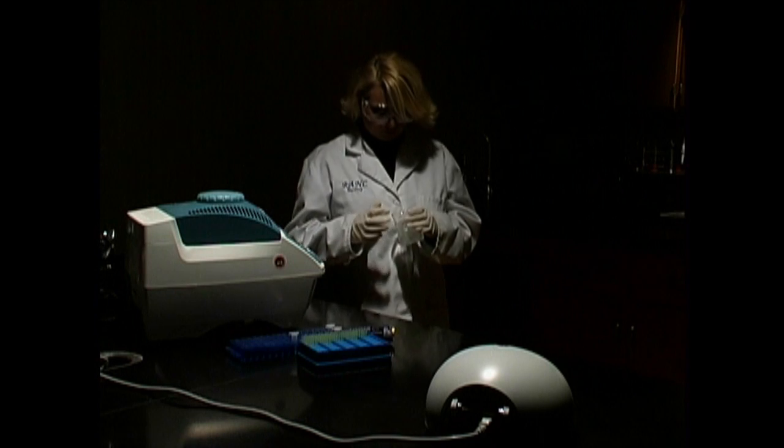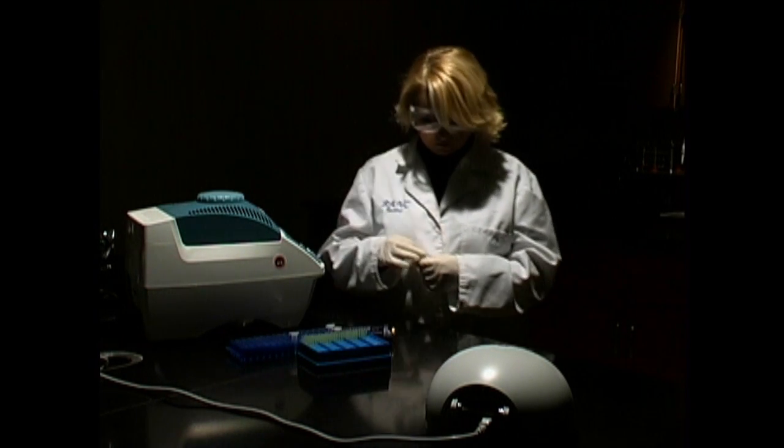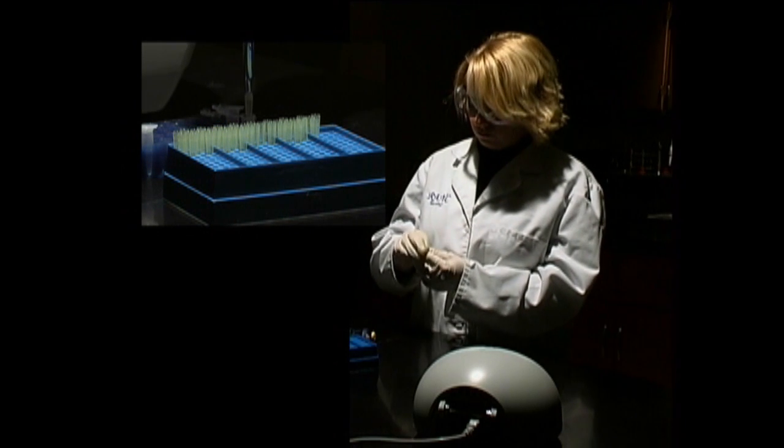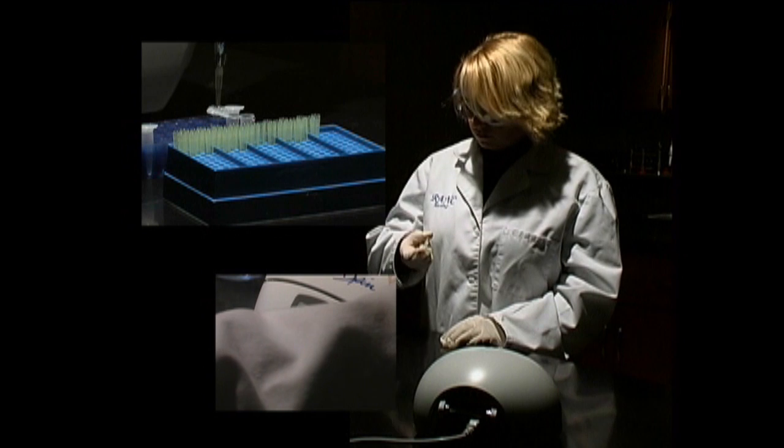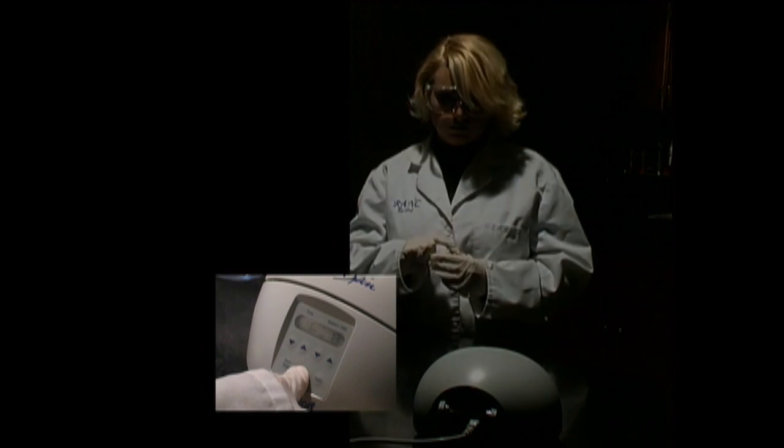Obtain a tube containing Taq polymerase, the four nucleotides, and buffer. Add to that the D1S80 primer and your cell DNA supernatant. Gently mix the solution, and then microcentrifuge it for 10 or 20 seconds at high speed.